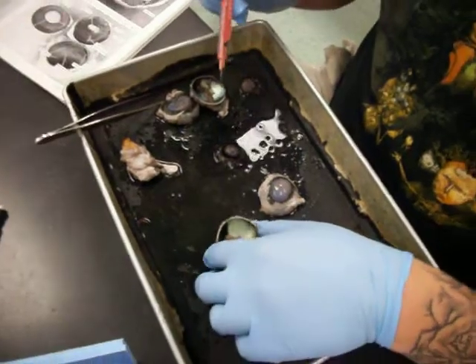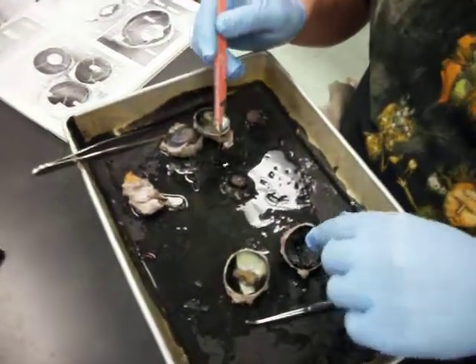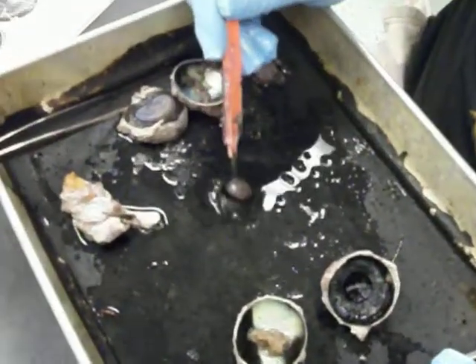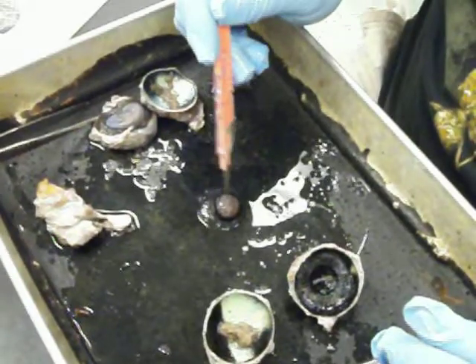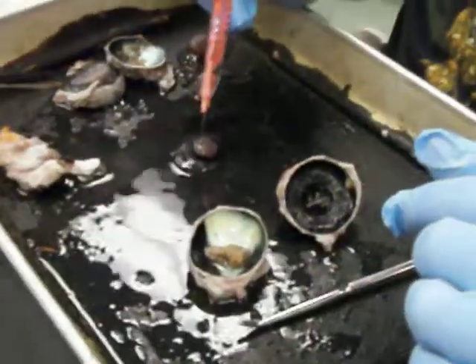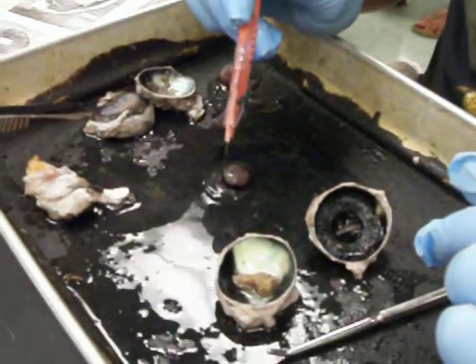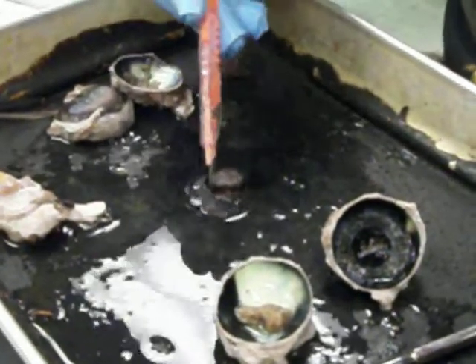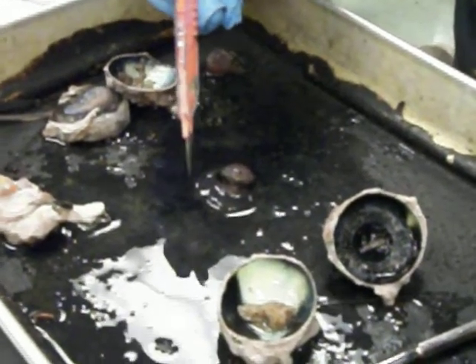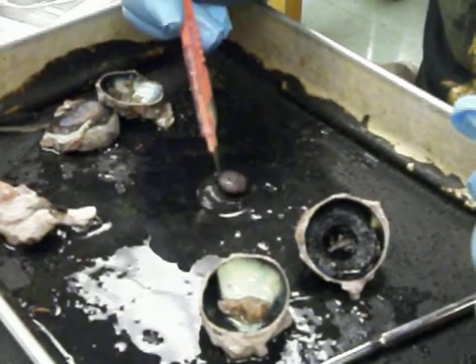Now, the cough drop actually fell out of here when I cut it open. This cough drop right here, and by the way, you can stick the blade through it and it's still real hard like a cough drop. That is the lens. But if you notice the egg whites that haven't been cooked yet, that the cough drop is surrounded in, that is the vitreous humor. Once again, that looks like an uncooked egg white or some clear jelly.